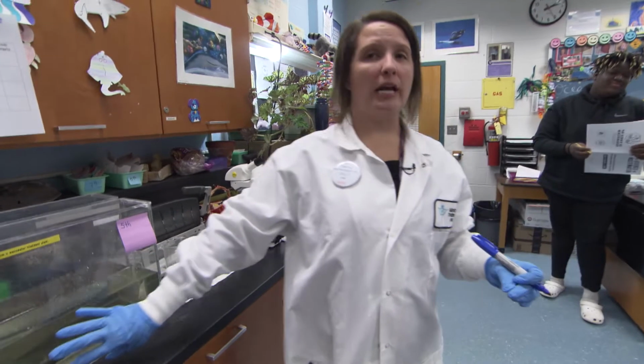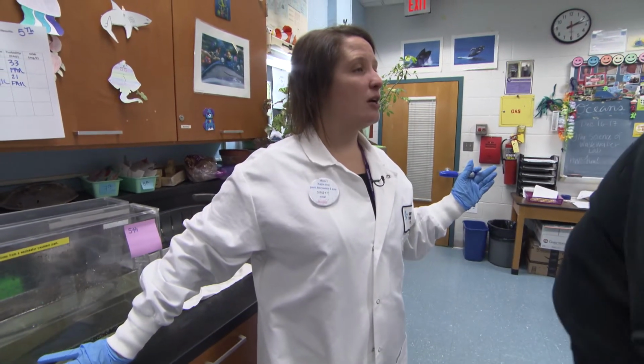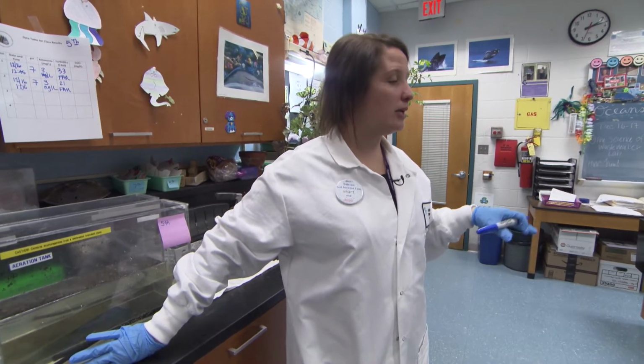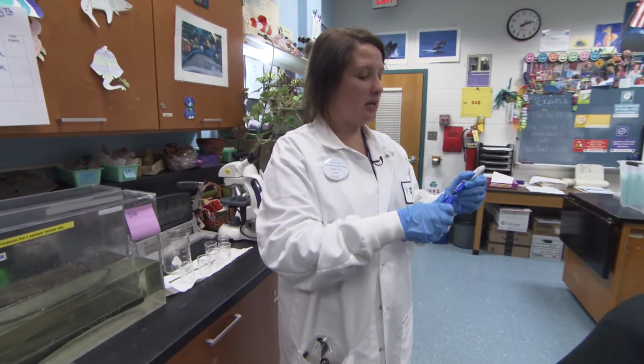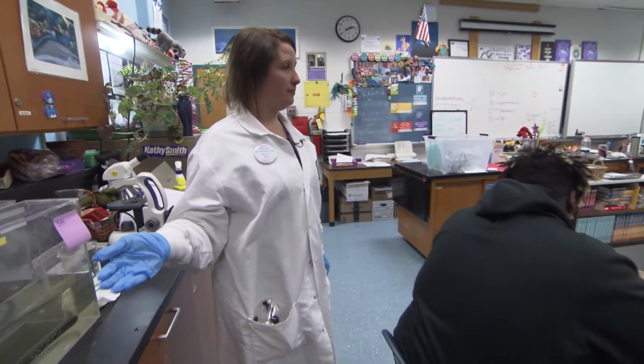And so now what we're getting ready to do is start secondary treatment, which is the biological component where we're going to put in bacteria that are going to do some work. Secondary treatment is a biological process that uses microorganisms and oxygen to remove nitrogen waste and organics from wastewater. With your students, discuss secondary treatment and how it connects to the nitrogen cycle and eutrophication.